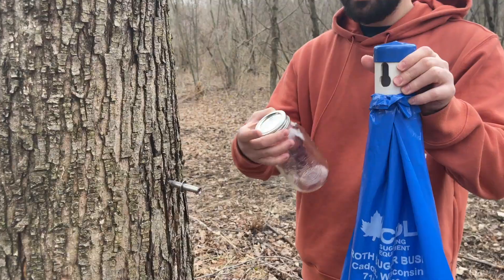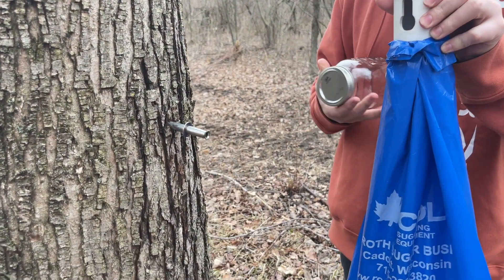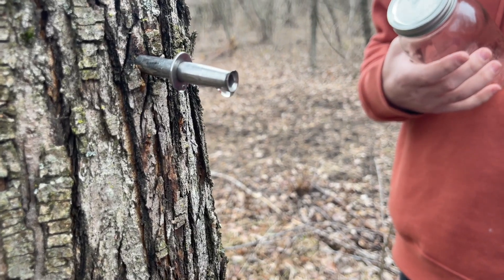Welcome back to Sporn Sprout. In this video I'm going to show you how to grow mushrooms using liquid culture made from tree sap.